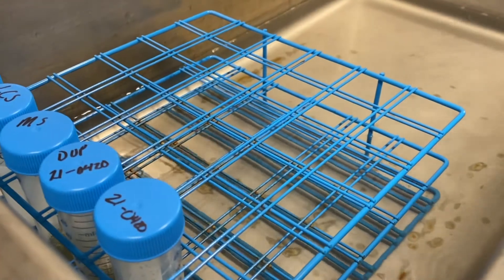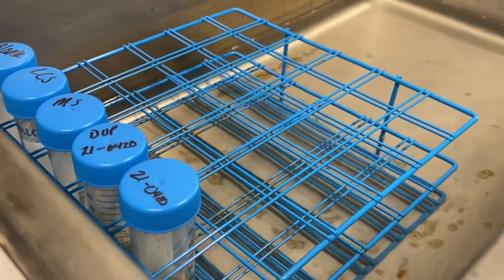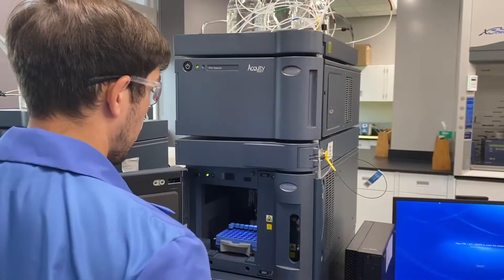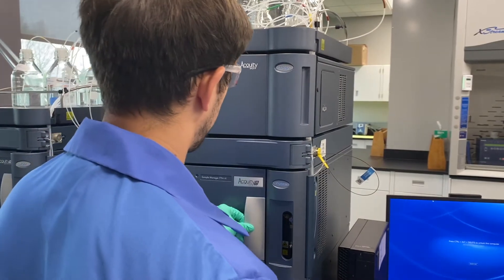After we have analyzed a hemp sample, we calculate total THC and then convert it to a dry weight basis.